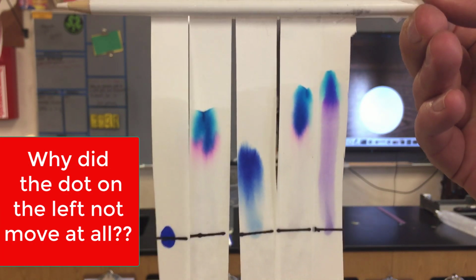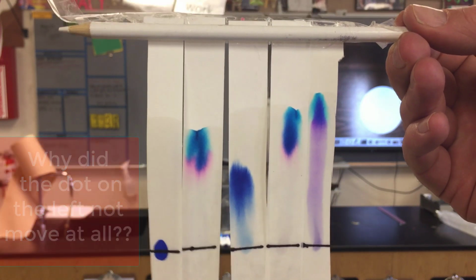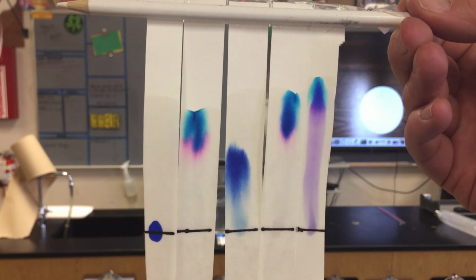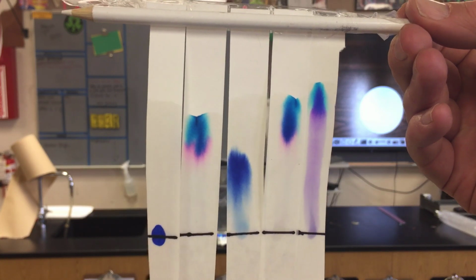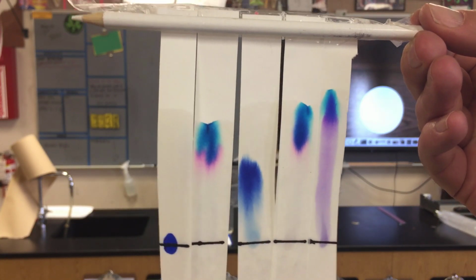Now, this is called paper chromatography. What's neat about this is you can use it to compare an unknown sample of ink. Let's say you have 4 different colors of ink. It could have been one of those 4 different pens. If we use paper chromatography, we'd be able to identify which ink the unknown writing came from.